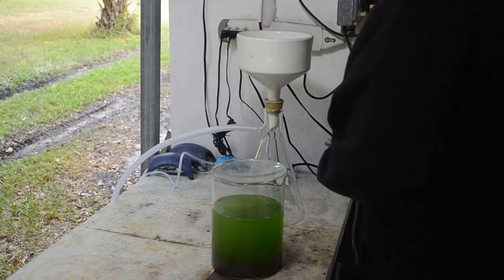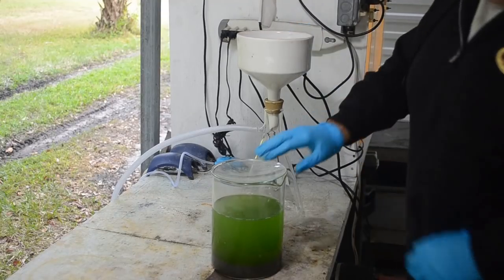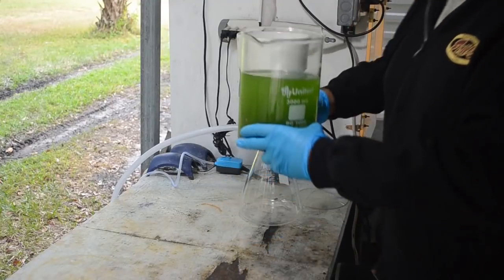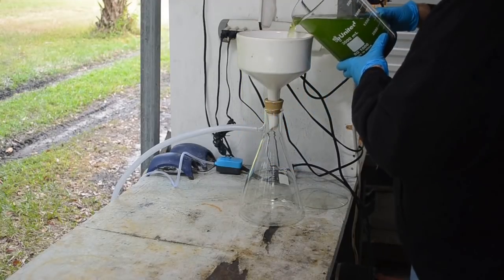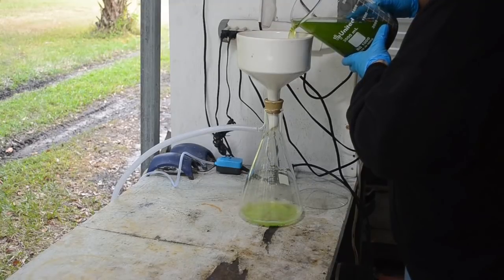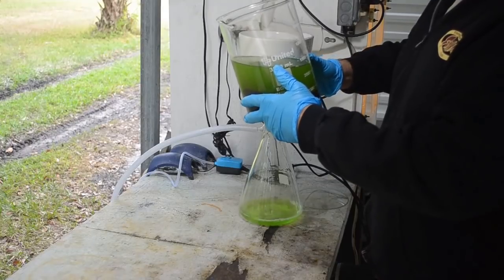Okay, so time to get this stuff filtered. And the liquid went cloudy when it got cooled and diluted by the ice, so I'm taking that as a good sign. Hopefully I can filter that cloudiness out and no more will develop. We'll see. I can always run it through the filter a couple times if I have to.